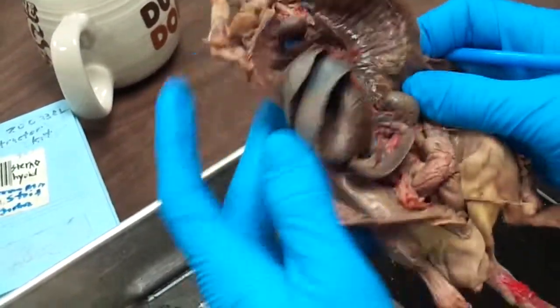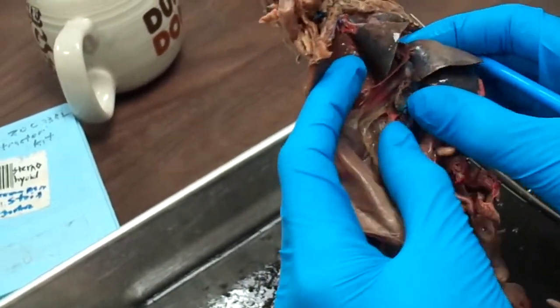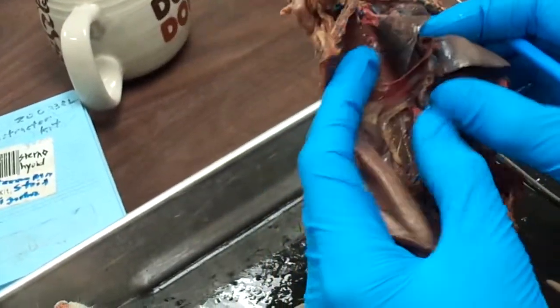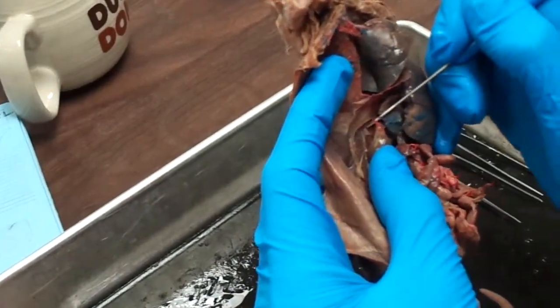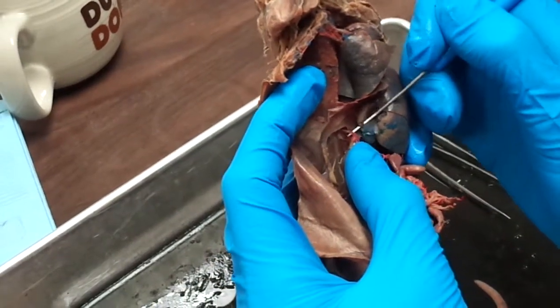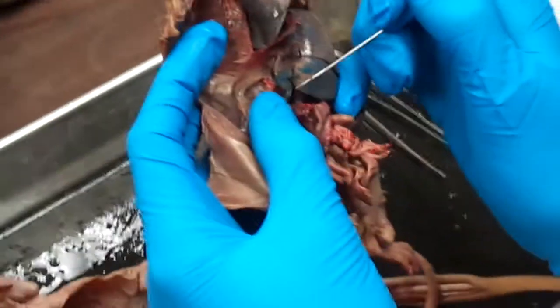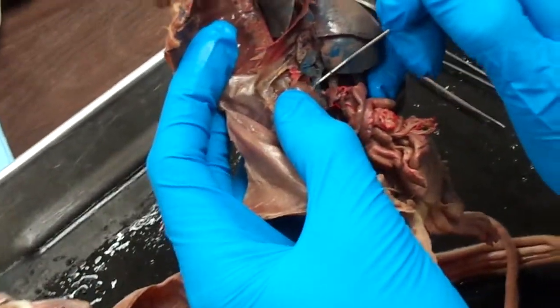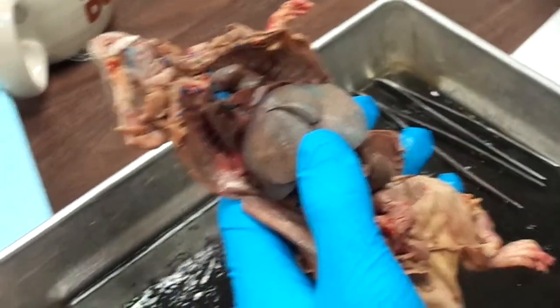So, phrenic artery, and also coming out of the same area and going through dorsal, it's kind of hard to see there, but it's going to split off and come to the adrenal artery. The adrenal gland is located right above the kidney, this red mass that you see. So you can see the adrenal artery right here. Don't confuse that with the renal artery coming into the kidney, but we'll get there in a second.